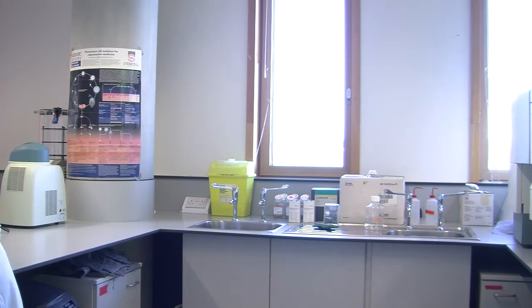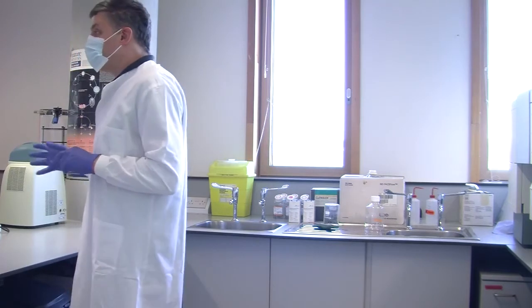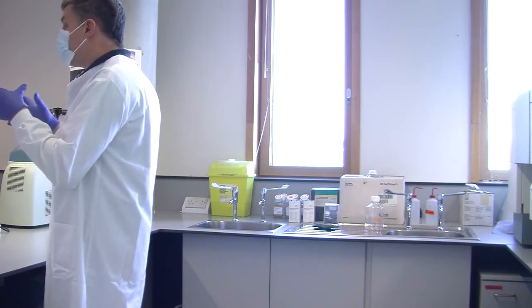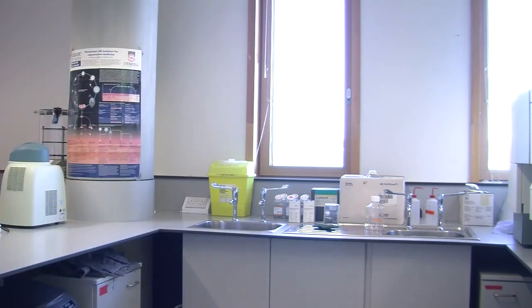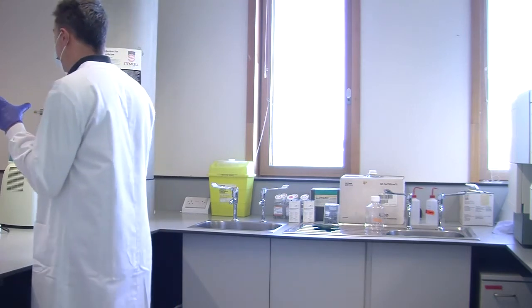This is not a step you run for every experiment. One example, sorry, this one has saponin. Saponin is a plant-derived detergent, and it dissolves the membrane away, so it allows the antibodies inside. It's better than methanol. Because they've been fixed, they won't fall apart.